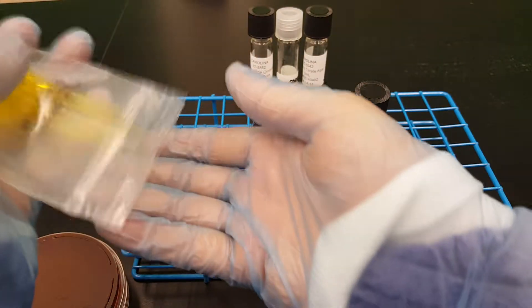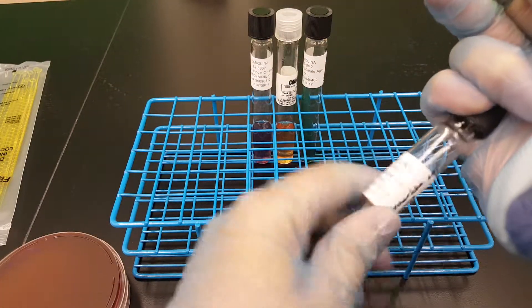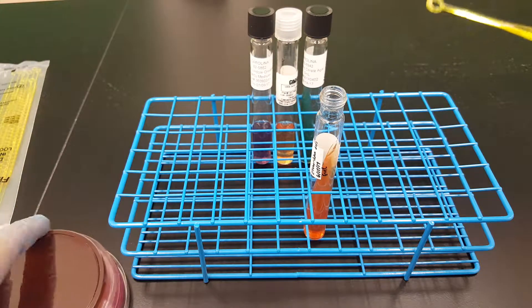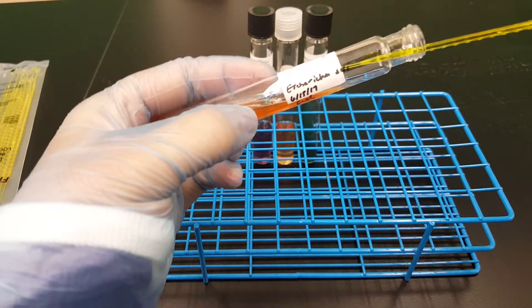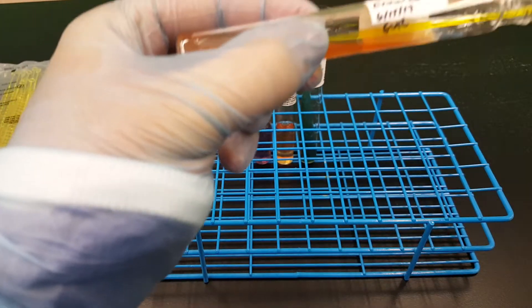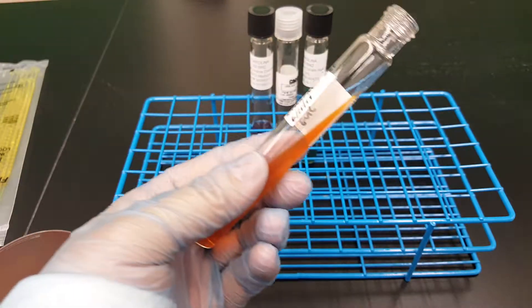Last but not least, we've got the triple sugar iron agar, the TSI slant. Just get some E. coli. Remember, I'm going to stab and then streak. I didn't stab very well — it's moving. I'm just going to streak and then go back with a needle and stab it, because my media is moving. It's warm in this room, so it got loose.